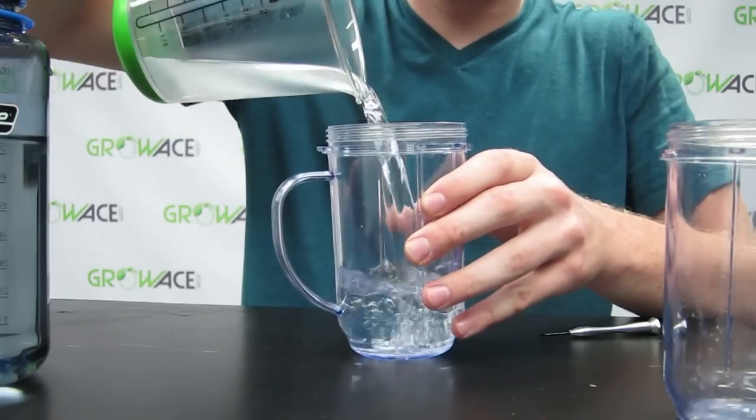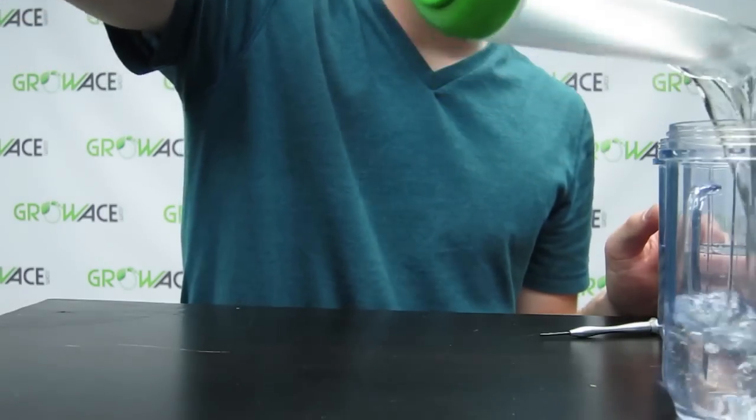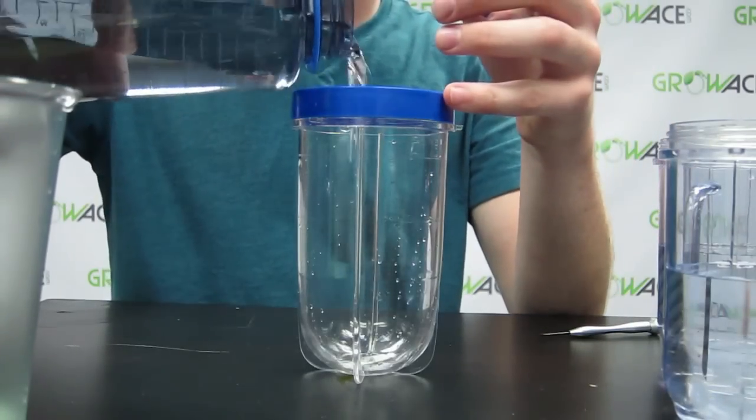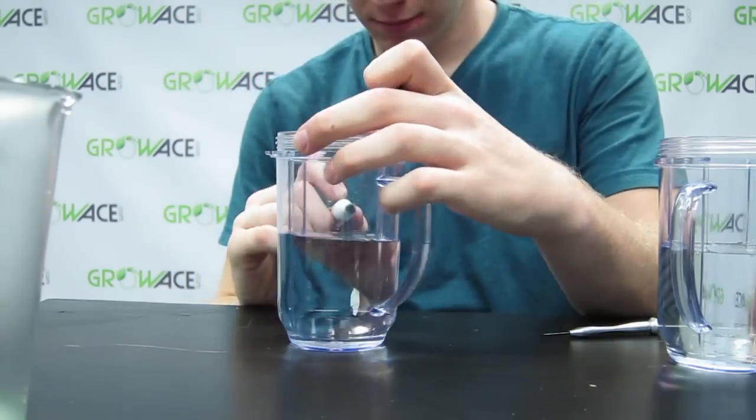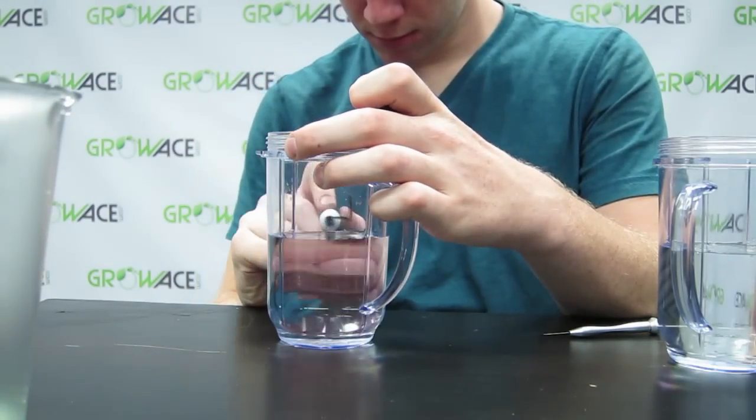Get your three cups. Fill two of them with 250 milliliters of water and the other one half to three-fourths full of water. Mark the 250 milliliter cups with a four and a six.